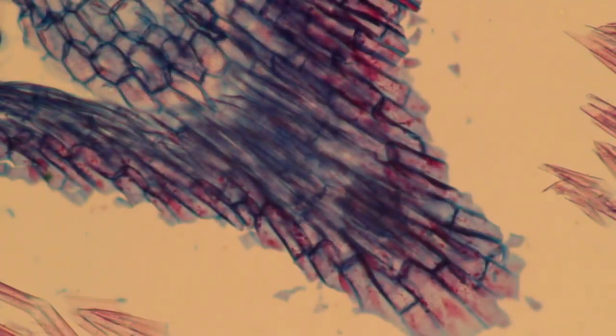This was a very basic introduction to the microscope. I hope this video helps you not only have an easier time finding the specimens of interest under the microscope, but also that the microscopes are prevented from damage. Microscopes, when they are properly used, can last quite a long time.